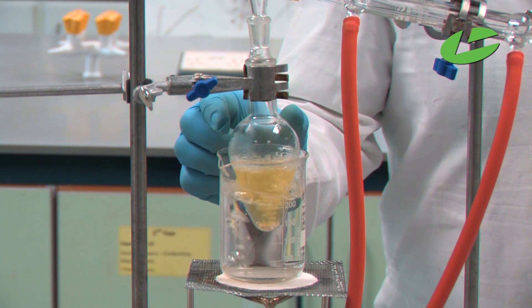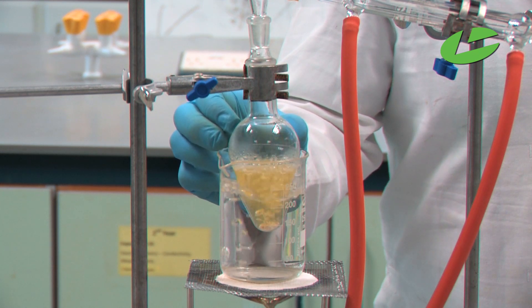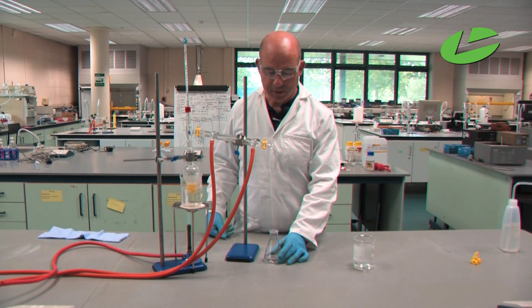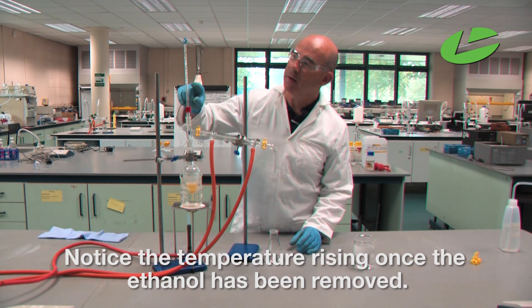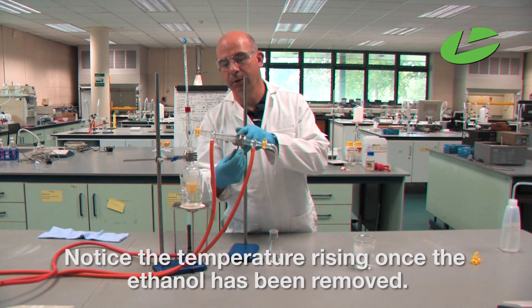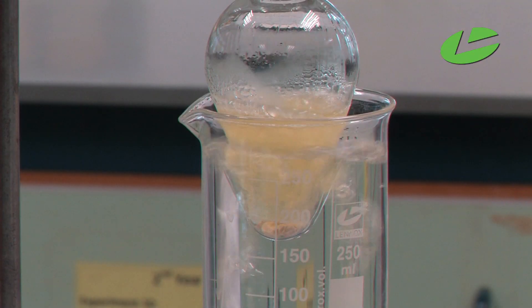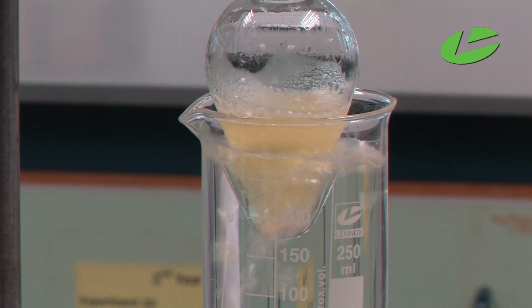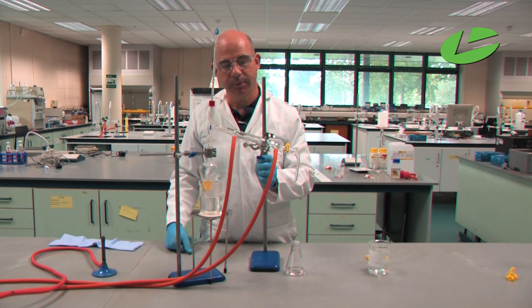Once all the ethanol has been distilled off, all that remains in the reaction vessel is the soap and the side products of the reaction. Now nearly all the ethanol has been removed and I can see the temperature is starting to rise, so I'm going to remove the pear-shaped flask from the heat and disassemble the apparatus.